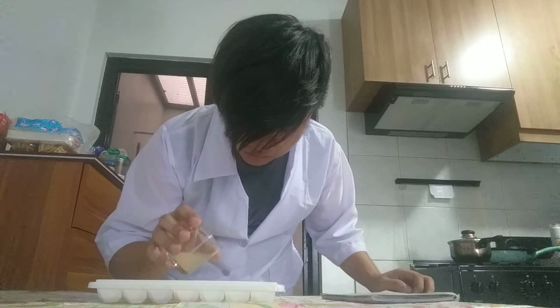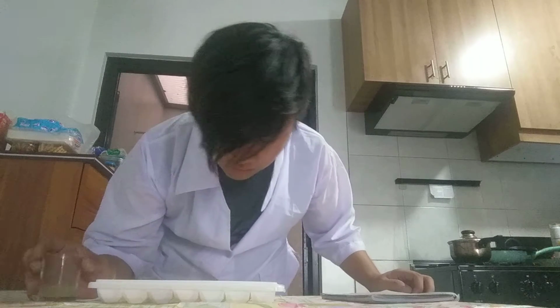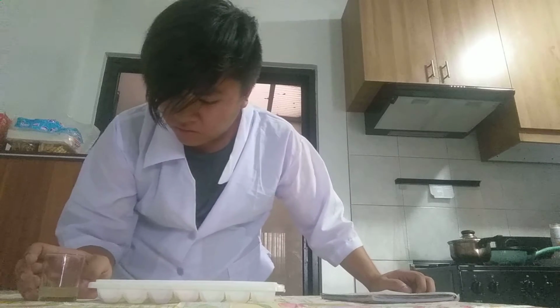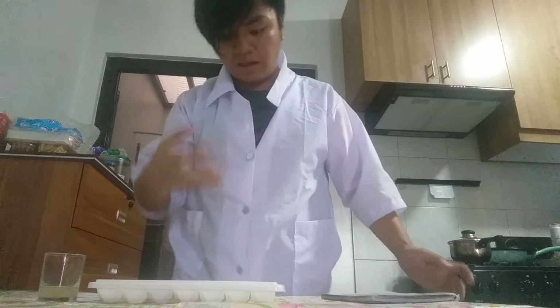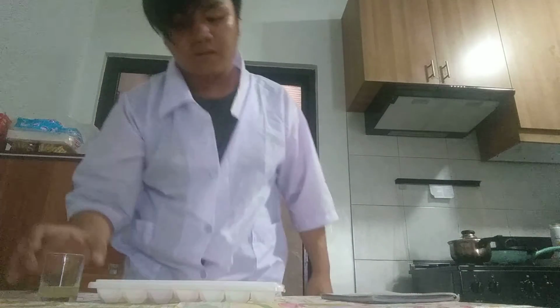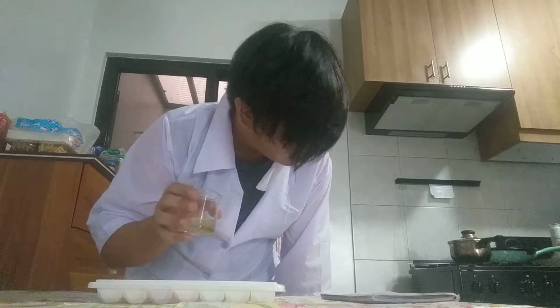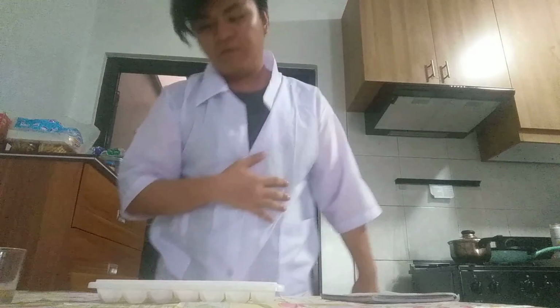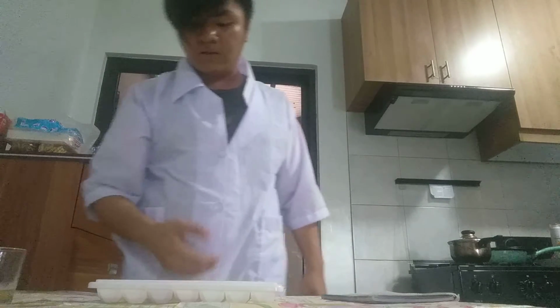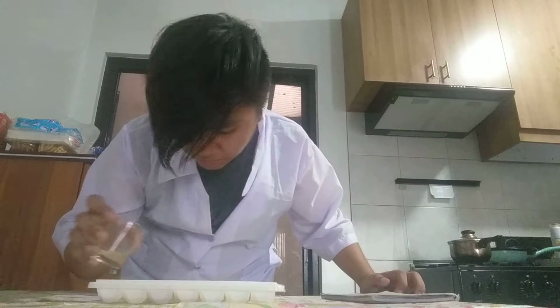Okay, vitamin C in water. Let's go. For me, it's a mix of orange and then yellow. But yellow is the more powerful color than orange. So I guess that's it. Next up, brown sugar in water. Okay, so now the orange is the more powerful color than the light brown color. Next up, shampoo.